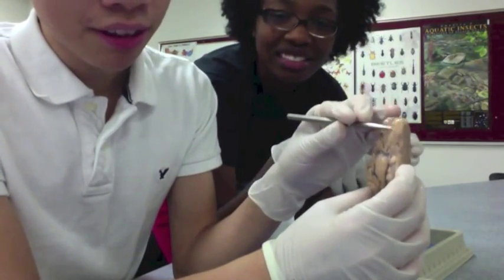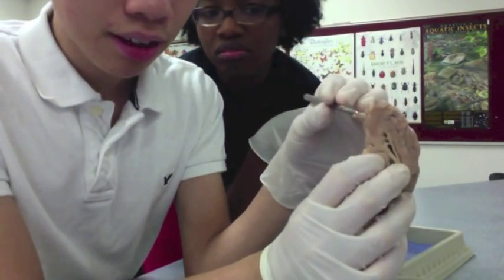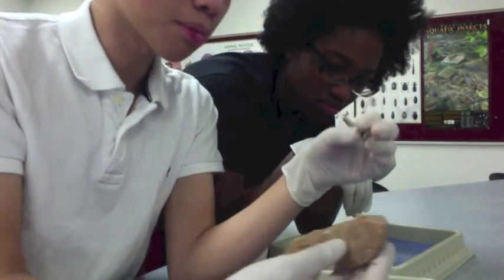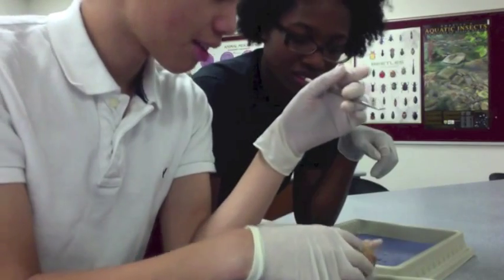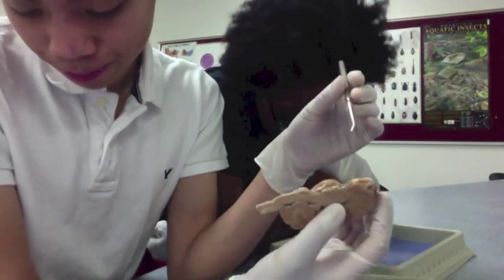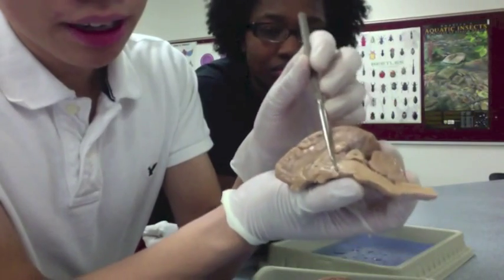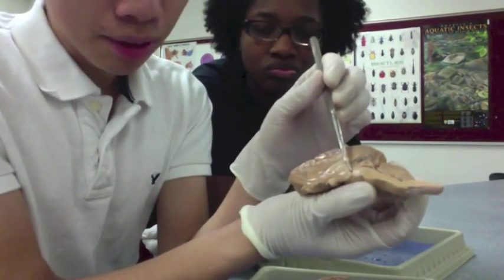You have the olfactory bulb, which is this little thing right here — a little bulb thing. That is your olfactory bulb. You have your optic nerve — that's where your optic chiasma is. The thing that comes off your optic chiasma is your optic nerve. Mammillary body — this right here is your pituitary gland, and the one behind that is your mammillary bodies.